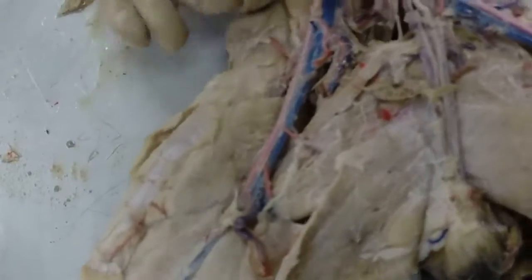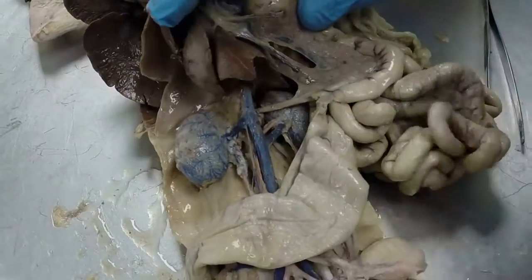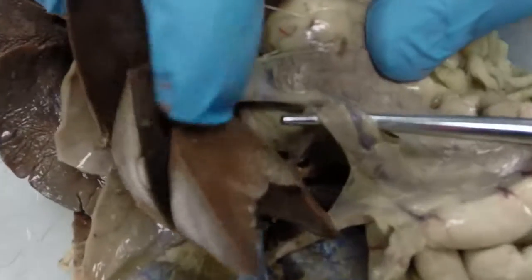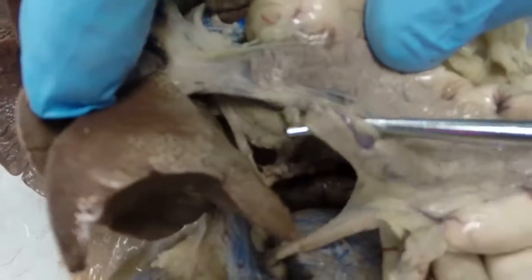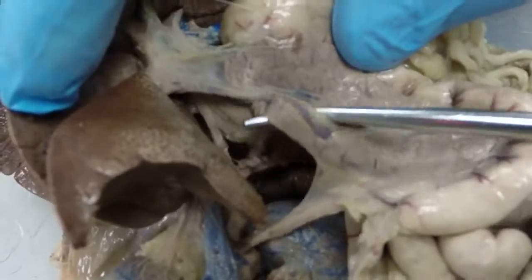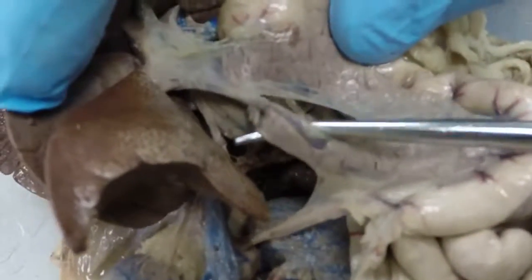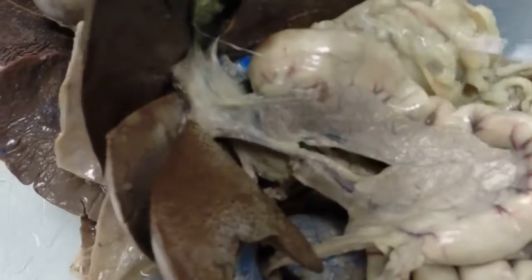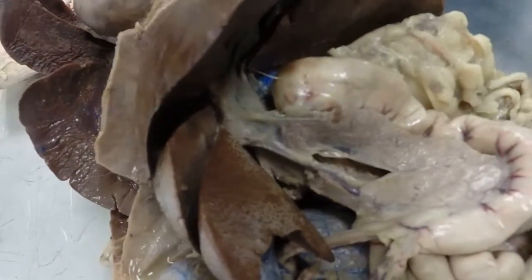And then we've got one more vein in here, the hepatic portal vein, which supplies blood between the small intestine and the liver. And so it's right here. And in some of these cats, we pay extra to get them injected with the hepatic portal system, so these will be bright yellow. This hepatic portal vein on your practical should be bright yellow. And that's all there is to learning the vessels on the cat.